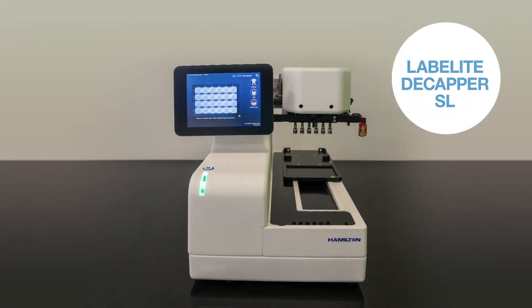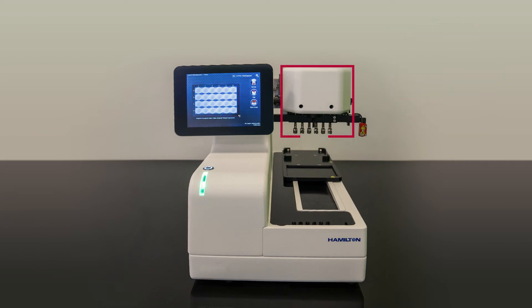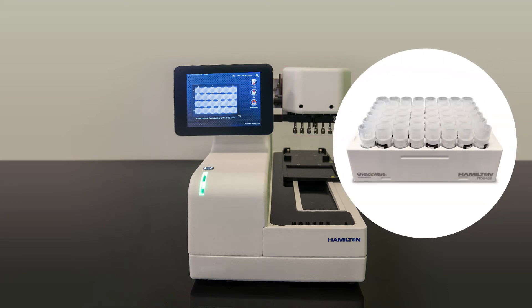Here is our LabElite Decapper SL model. As you can see, the previous user was working with 24-format labware and the 6-channel head is still installed. However, we need to decap these 48-format Hamilton 2 milliliter tubes. In order to do that, we will need to swap the head.